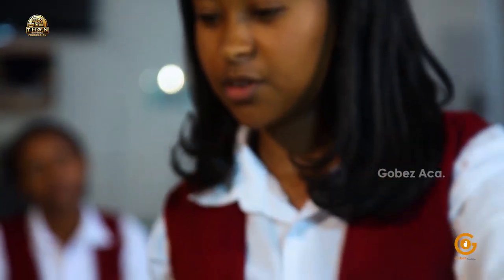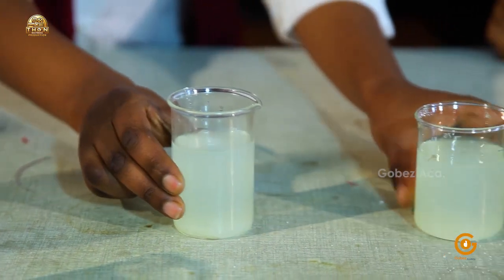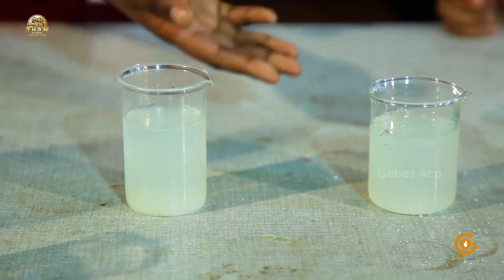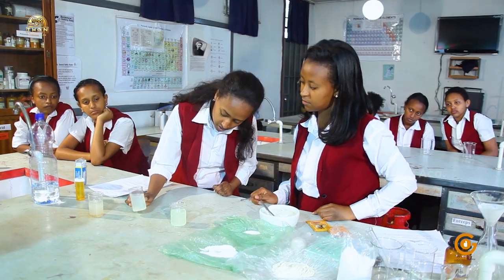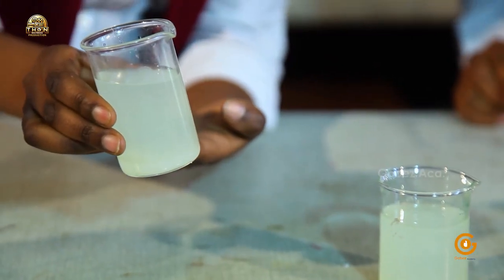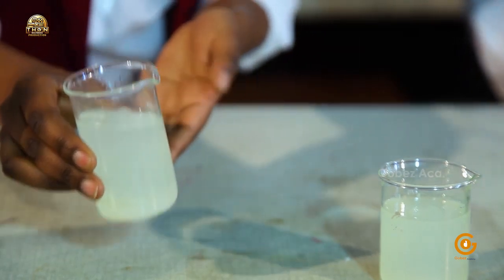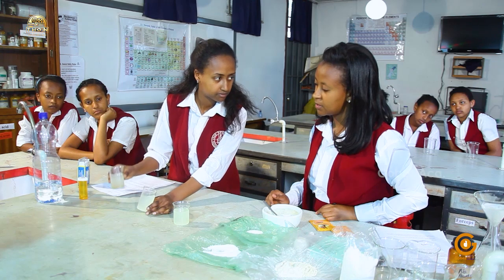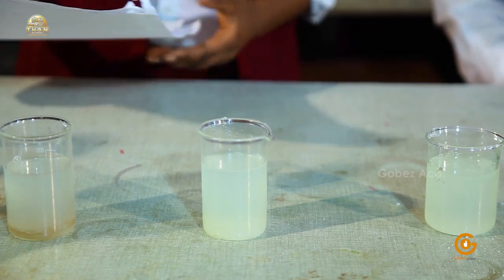So, what difference do you see between the 2 beakers? I think in your beaker you have stirred the solution, so the sugar has almost completely dissolved. And in my beaker, I didn't stir the sugar, and still there's suspension, which I mentioned before, because I haven't stirred the sugar, and it has characteristics of suspension, but it's still dissolving. And the third one, compared to this, it has dissolved, but there's still suspension. Yes, which has similar characteristics. Yes, as suspension. So here we have the procedure. I didn't mention it before.